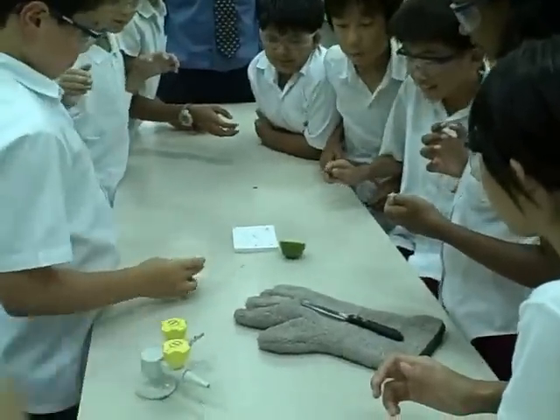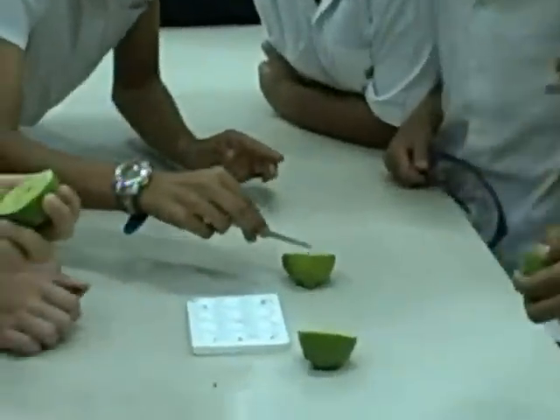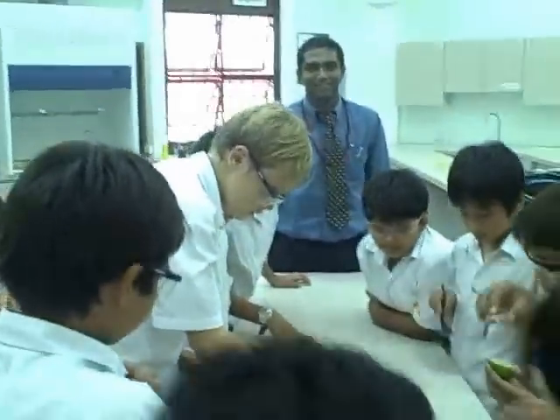Whoa. Get a mask. Oh, it smells sour. There you go. It smells bad. It's hydrogen gas, people.